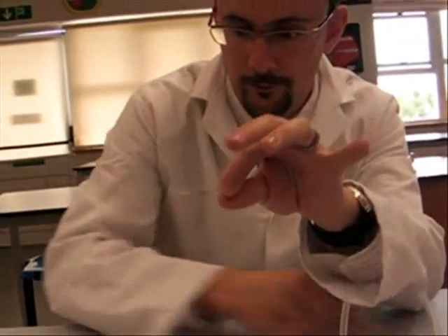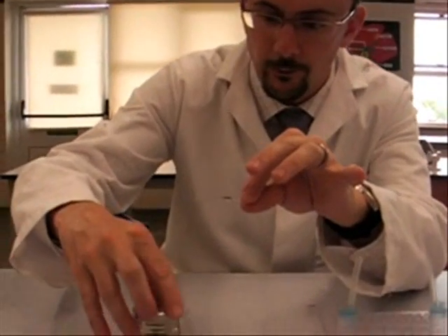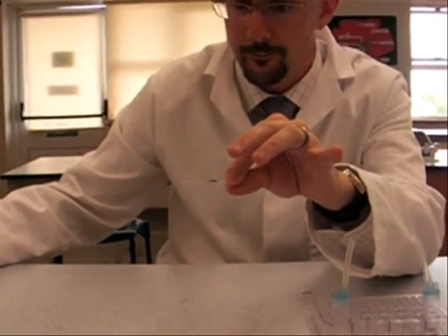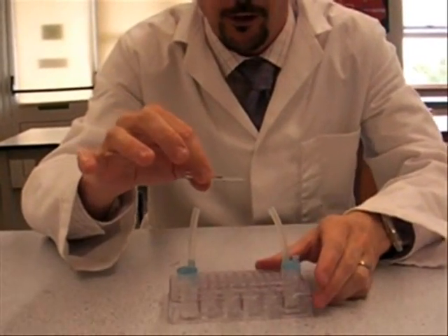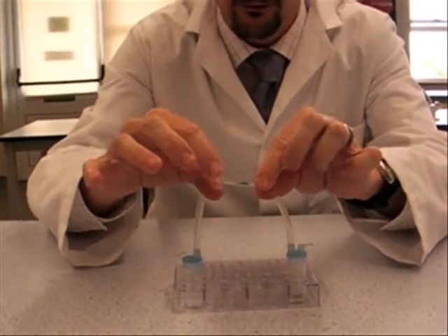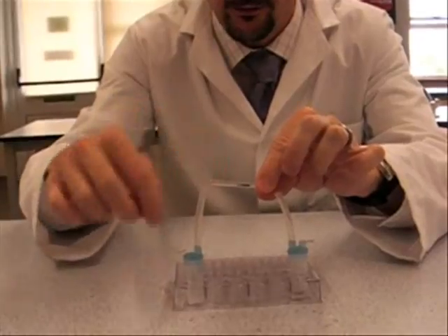You can go to one side. Get someone to put the lid on it for you and get rid of that. You don't want any of the... You want to keep this held horizontally. You don't want any of the black powder spilling into either of the two vessels at the end.